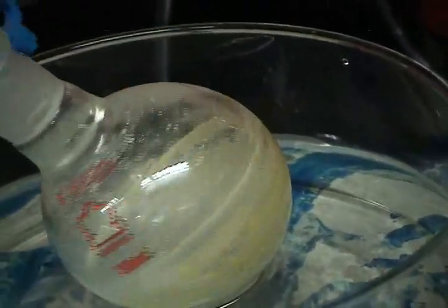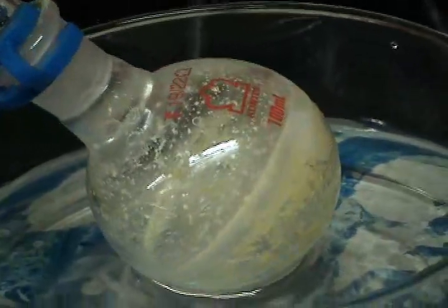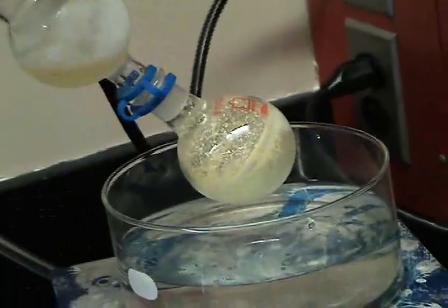To turn down the spinning, you can see that indeed, there is no liquid left in our flask. So at this point, we are finished rotovapping.